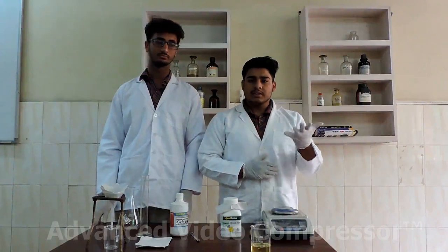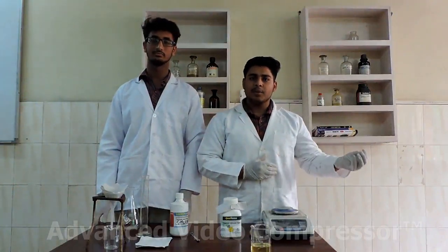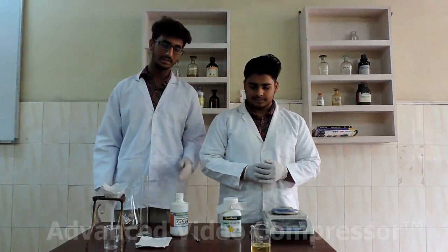Being science students, today we are going to apply our basic knowledge of chemistry to produce biodiesel which could be easily made at home using some chemicals which can be easily brought from the market. The main ingredient is the used cooking oil which is present in every household and which is of no further use.